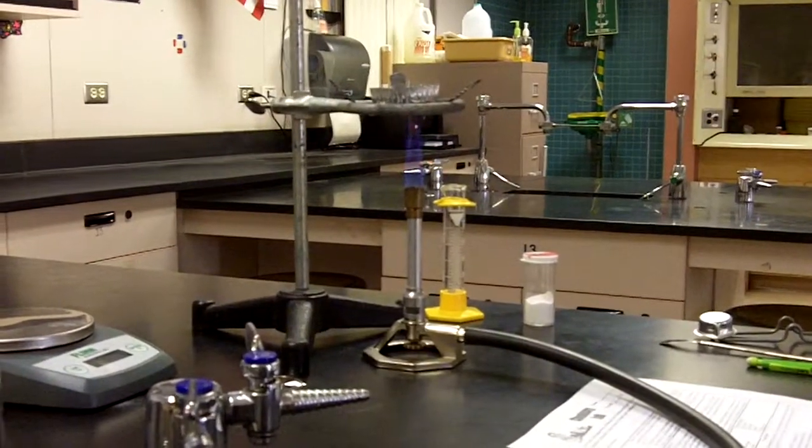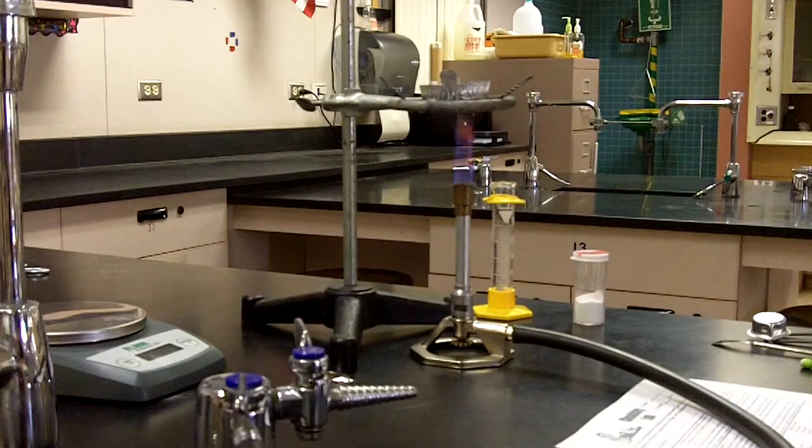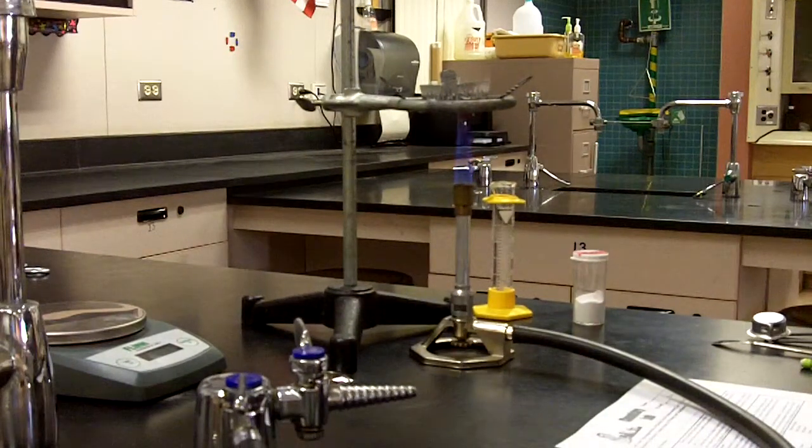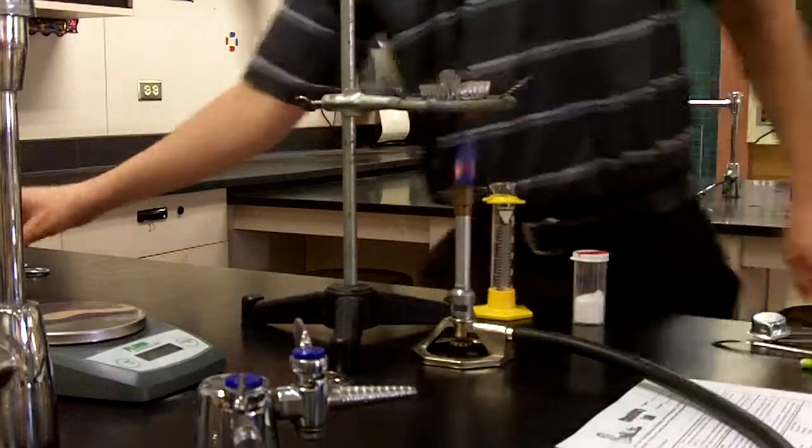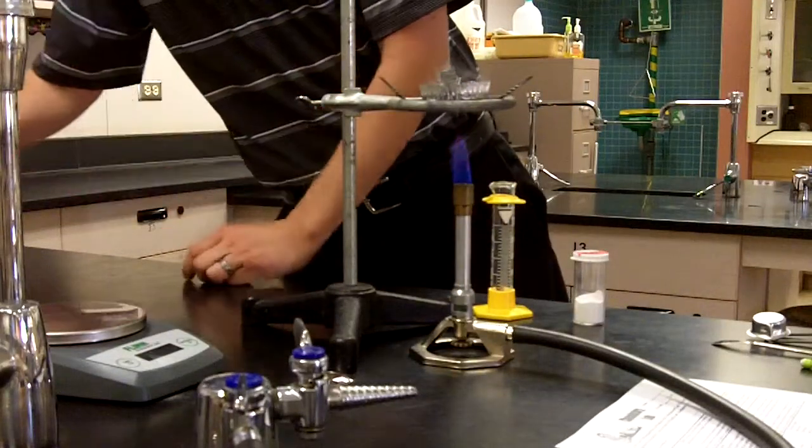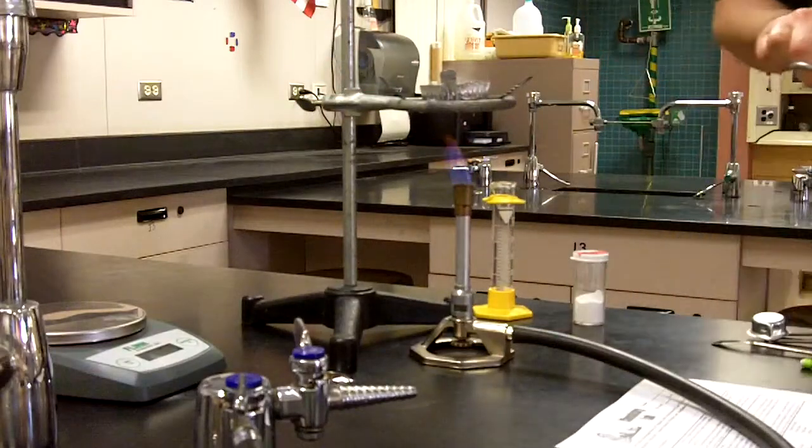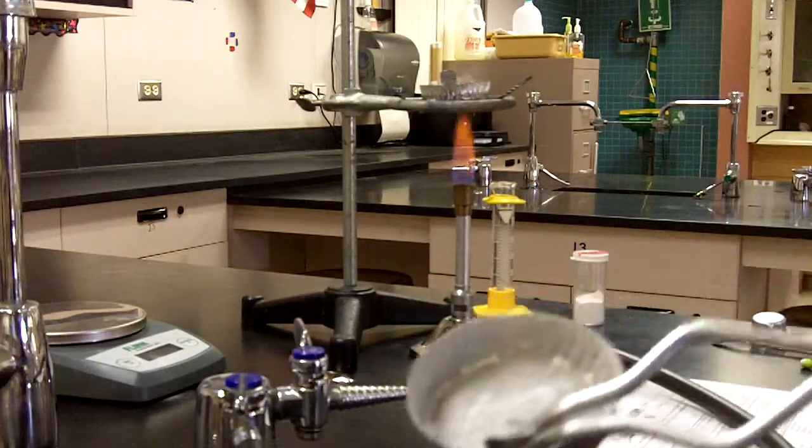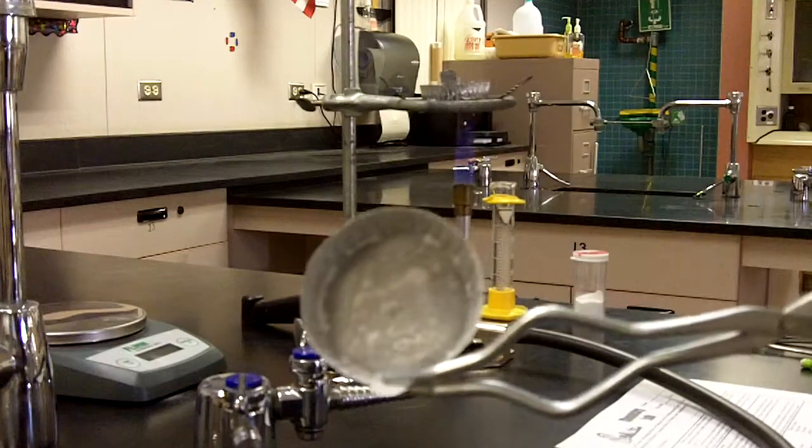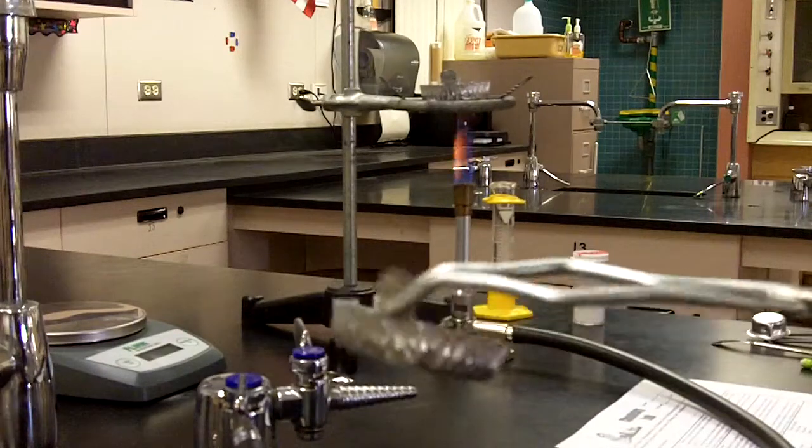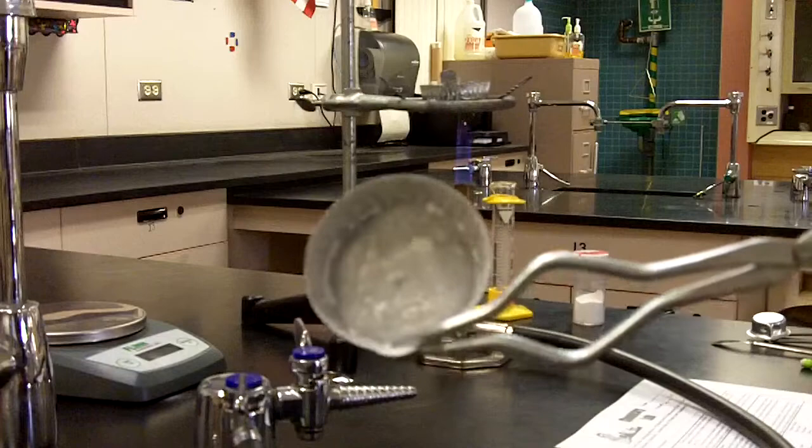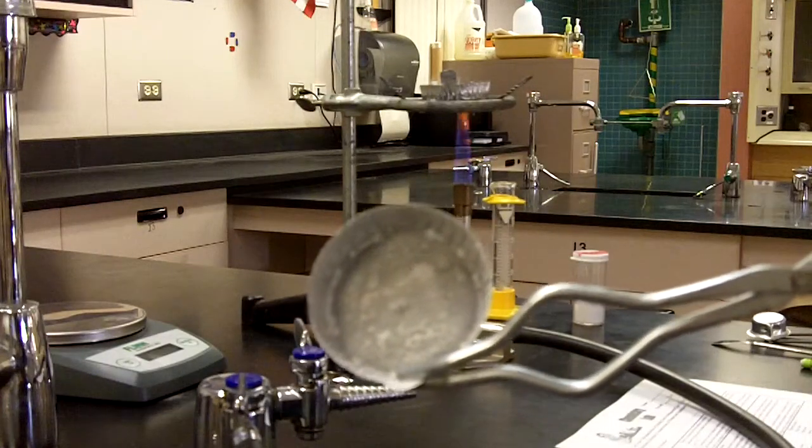Just like on the cooking channel, we have the materials already prepared for us. So we do have our solid material in this particular evaporating dish.